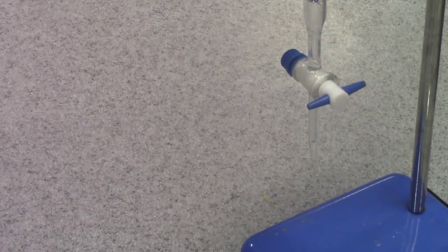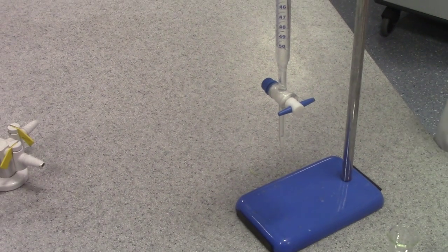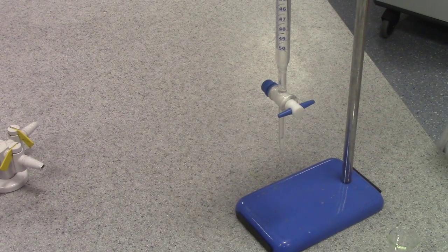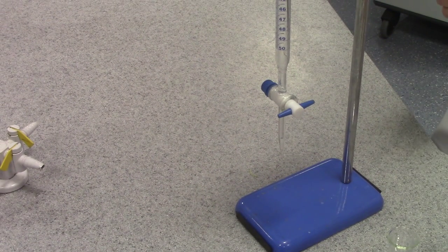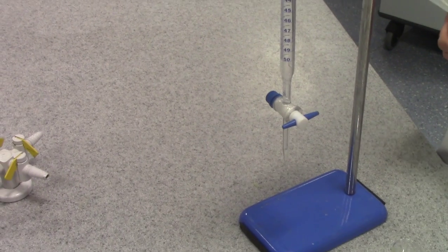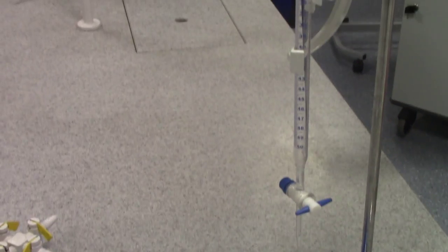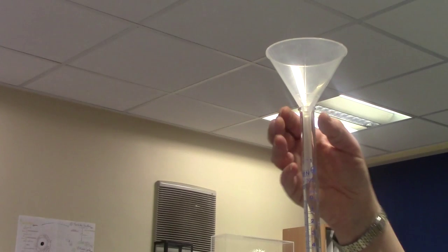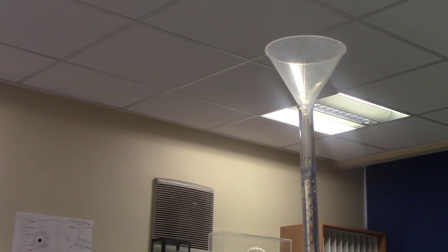When I use my burette, the first thing I need to do is to add my titrant to the burette cylinder. I'm going to use a funnel because it's quite a narrow tube and we don't want any spillages.